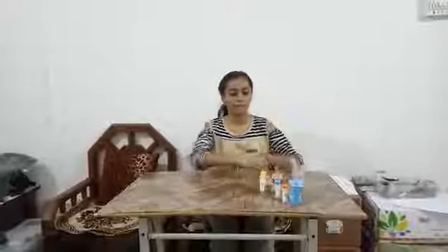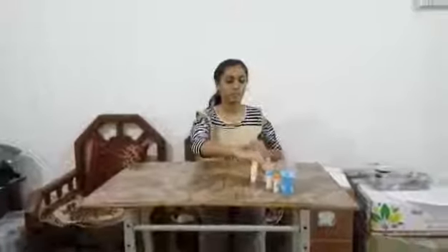Hi friends, this is Sanika. Today we are going to find the pH of different substances by using pH paper. For that we need sodium hydroxide, citric acid, sodium sulfate, and sodium bicarbonate. This is the pH paper.